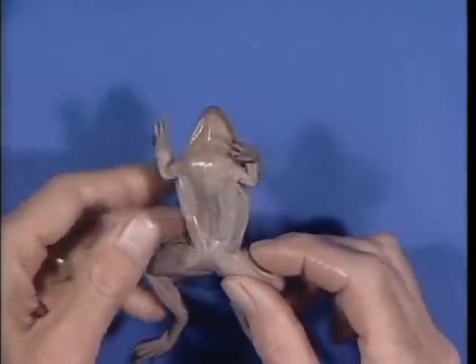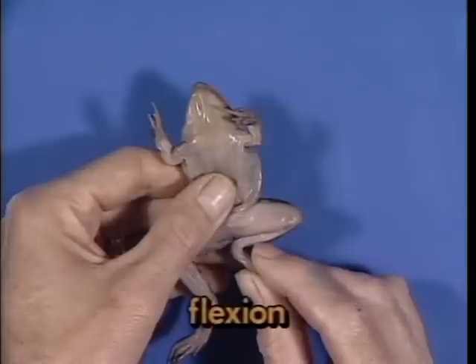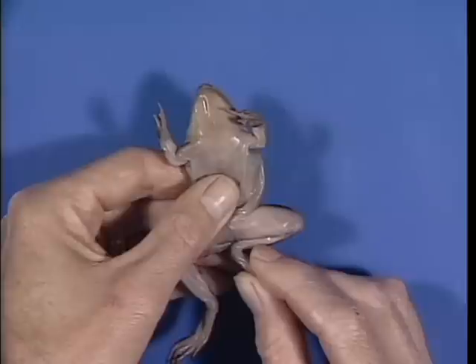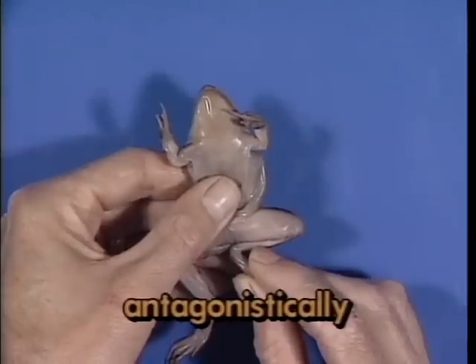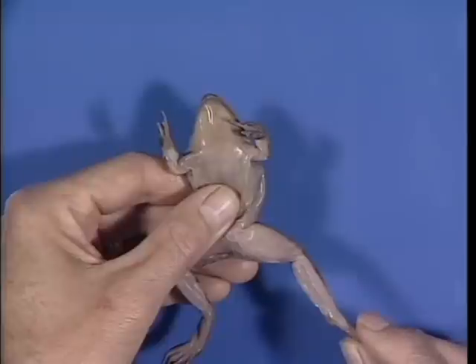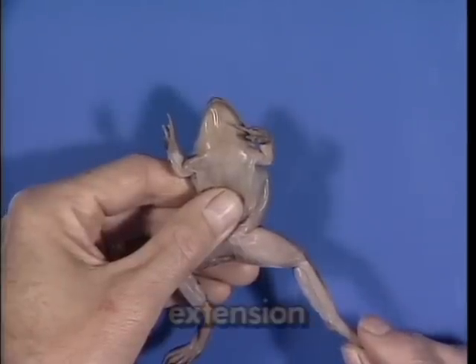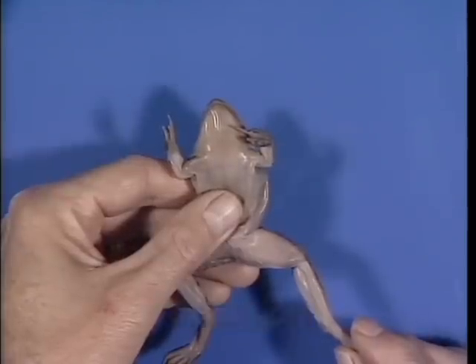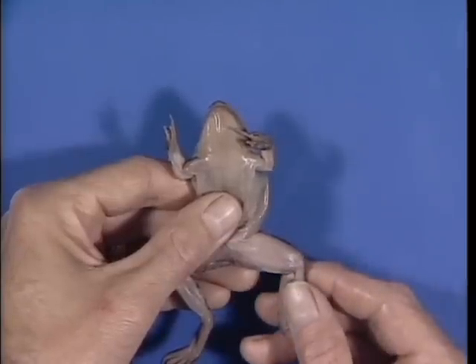Contraction of the upper muscle draws the leg closer to the body. This action is called flexion. Muscles often work in opposition to one another, or antagonistically. Note that if the upper muscle is relaxed and the lower one contracted, the leg can be made to return to its former position. This action of straightening the limb or increasing the angle between the two elements is called extension. Now that you know what happens when muscles contract, let's consider some additional common movements which limbs can undergo.